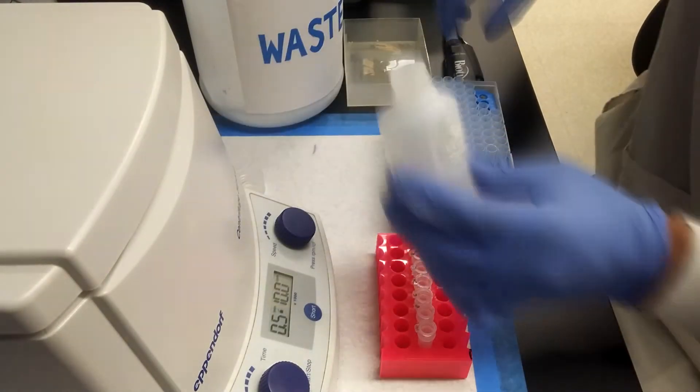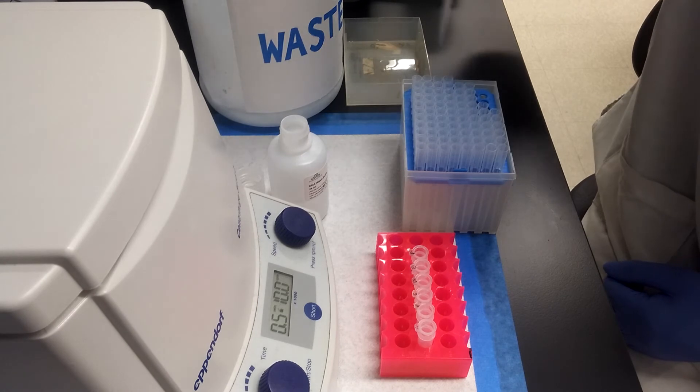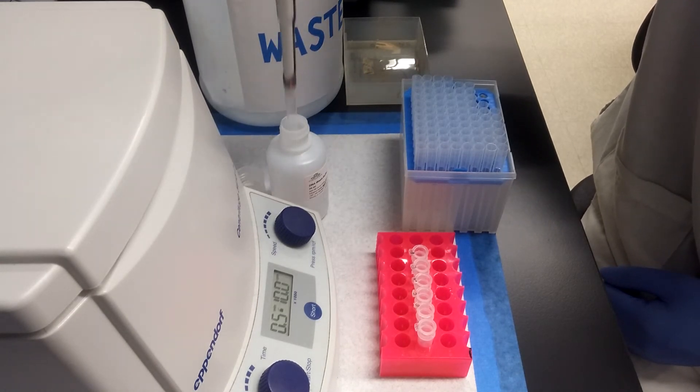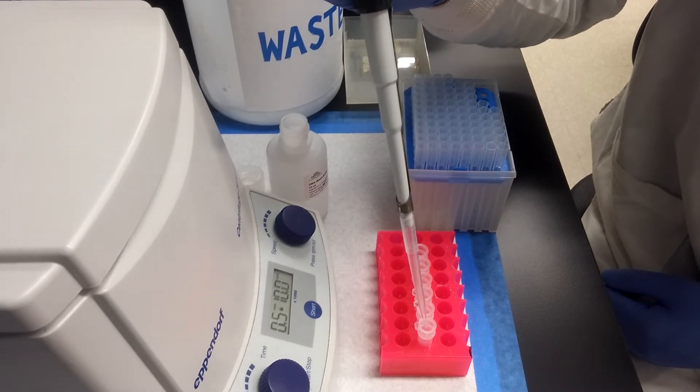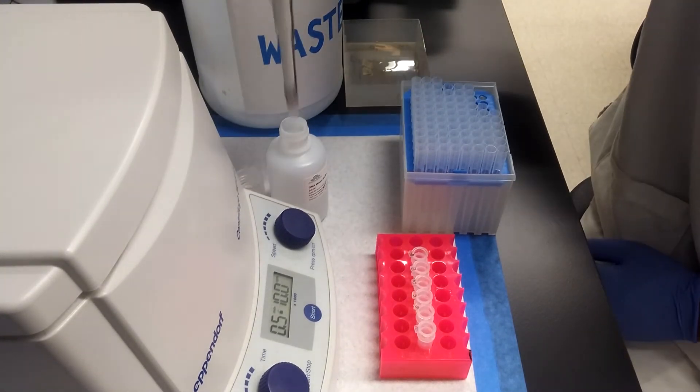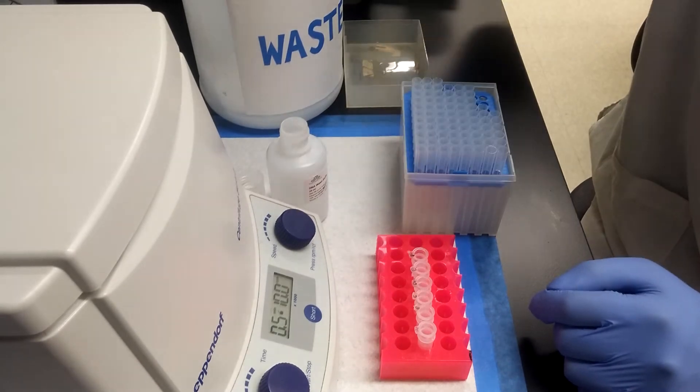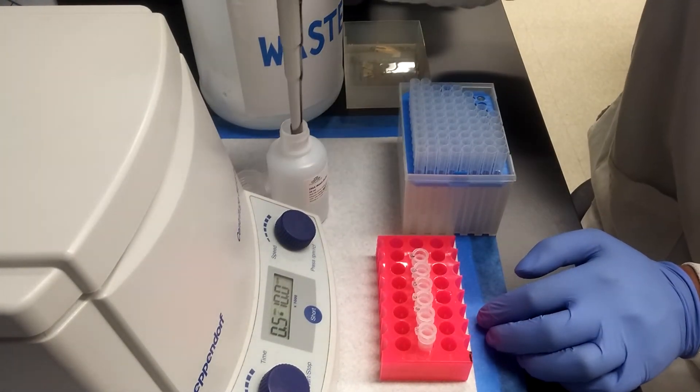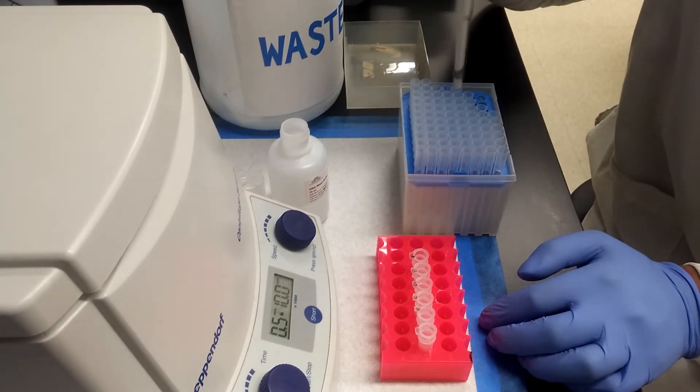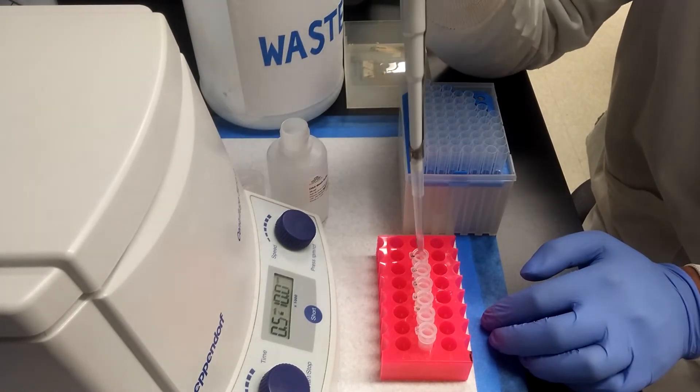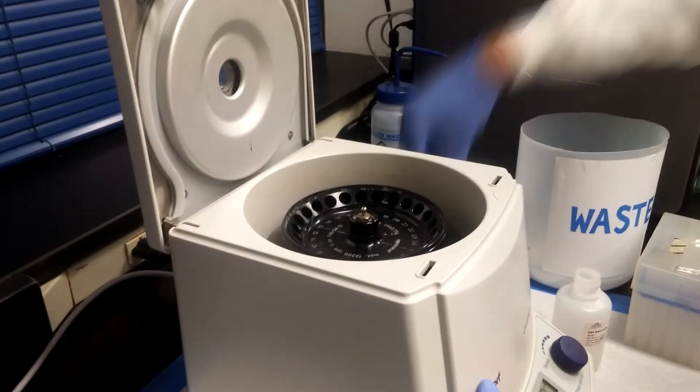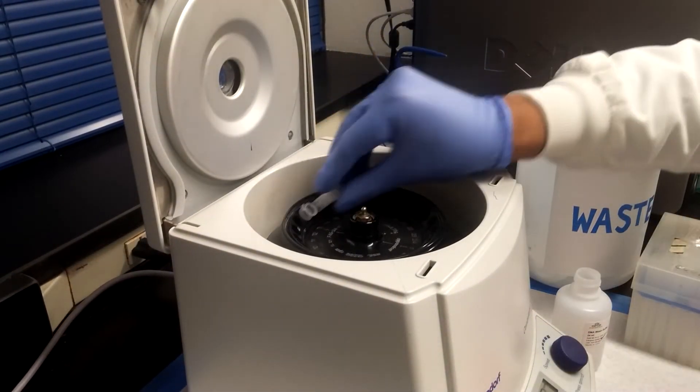The filter is then filled with 200 microliters of DNA wash buffer. The samples are centrifuged for a second time with the same settings.